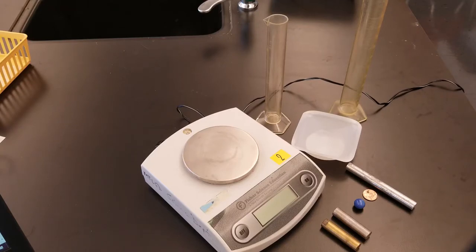In this lab we're going to teach you how to use the mass of an object and the volume by displacement of water to determine the density of a substance.